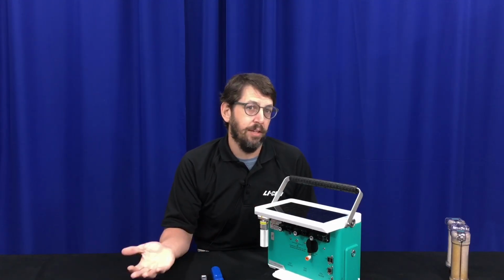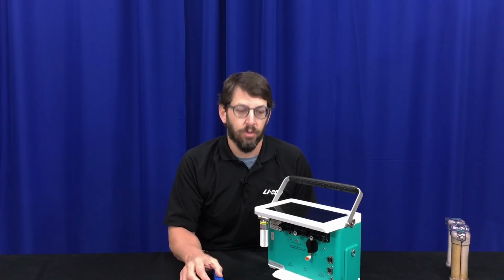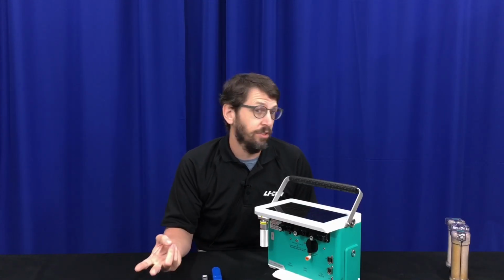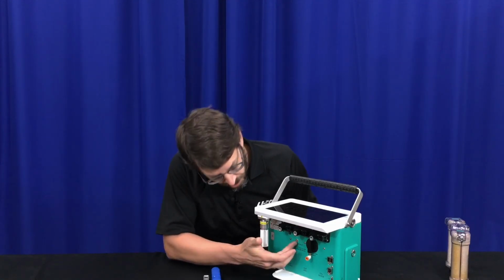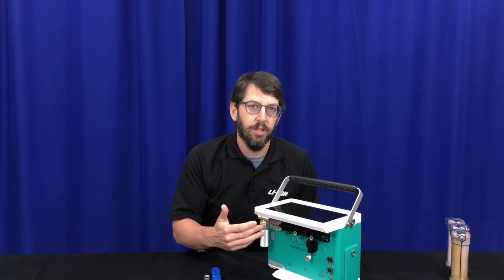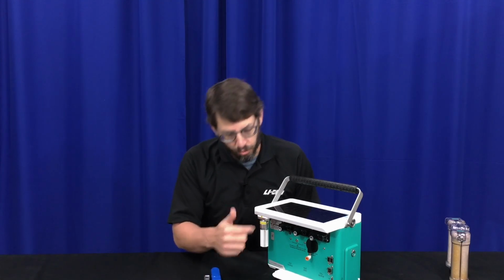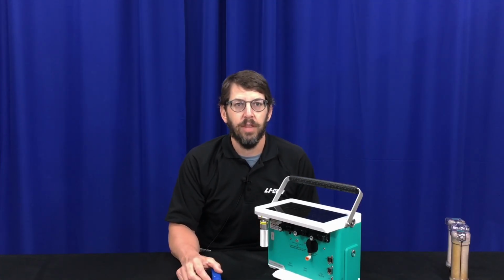If you do not need to scrub CO2 and you have a clean, well-regulated air source, then the auxiliary air inlet is probably a better choice. It's after the pump and after the CO2 scrubbing, but in that scenario you'll have a nice clean air source. You can still control water vapor, and you'll have nice constant flow rates. So we'll zoom in to these components and show a little bit about how you would set this plumbing next.